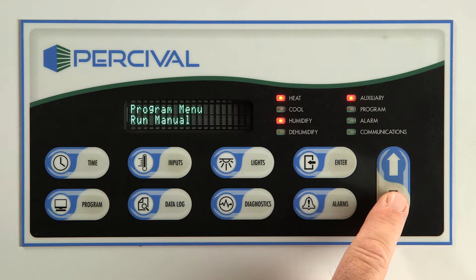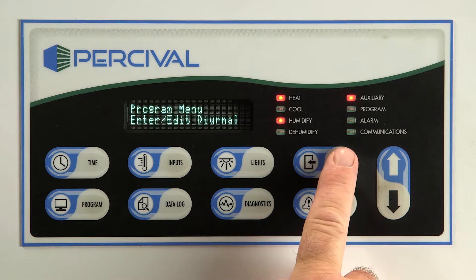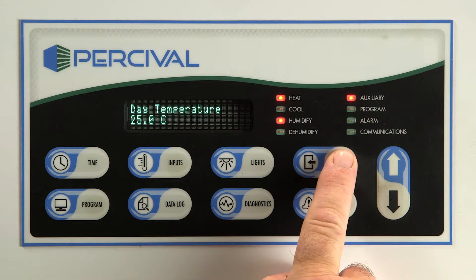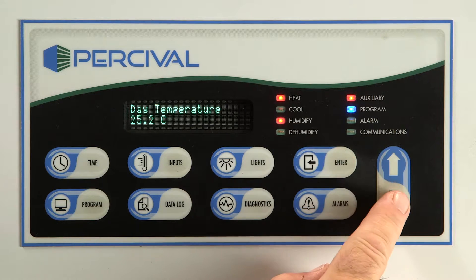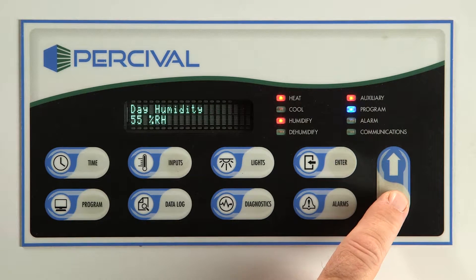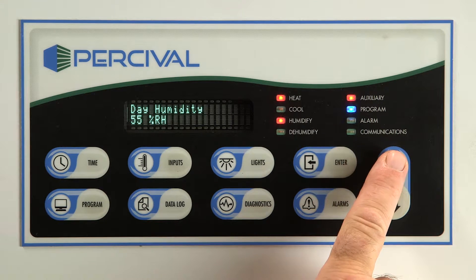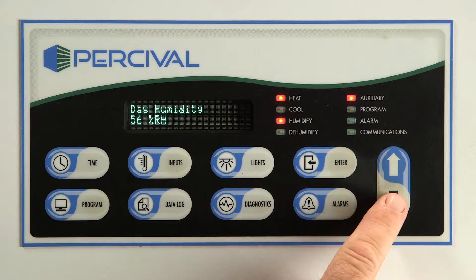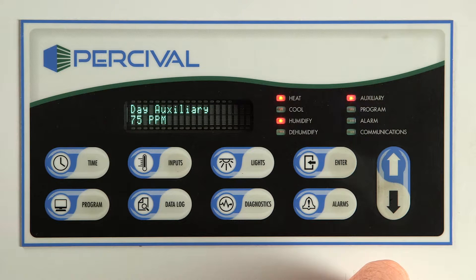Press the program key, arrow up or down, to enter edit diurnal. The first step is the day temperature. Press enter to edit the temperature. Adjust the day temperature to the required setting using the arrow keys. Arrow down to next step. Press enter to adjust day relative humidity if equipped. Set the humidity level using the arrow keys. Arrow down to next step.